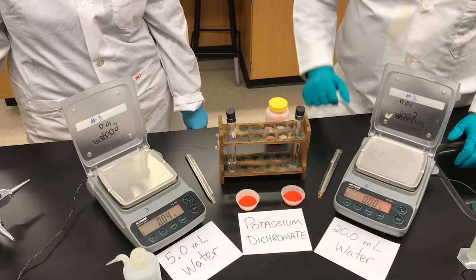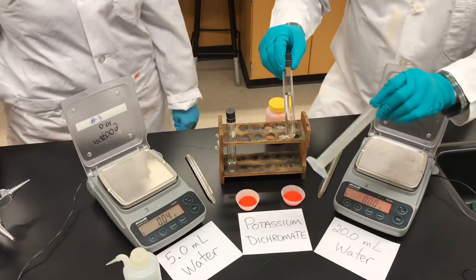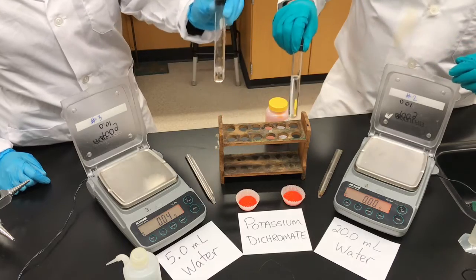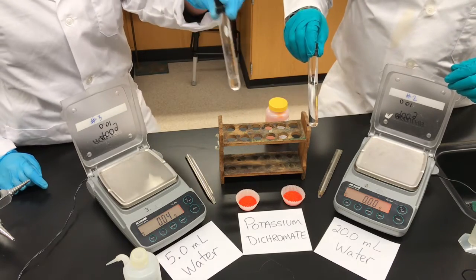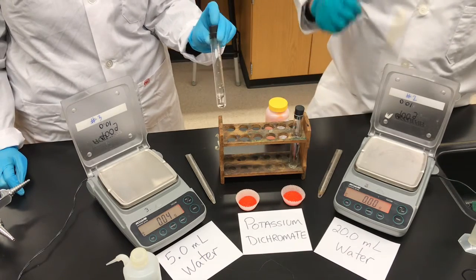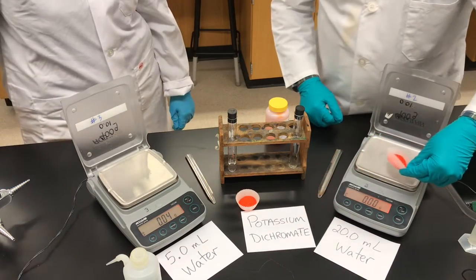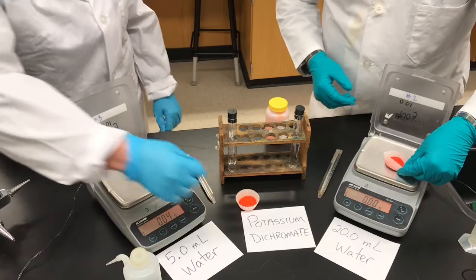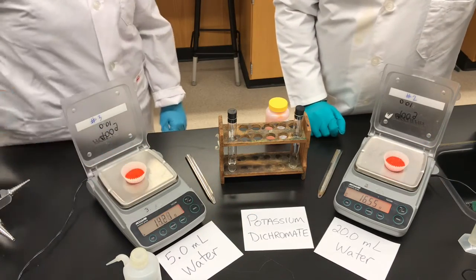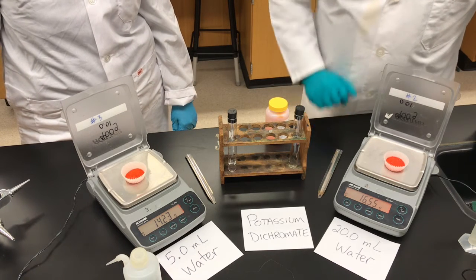We're going to get started. I've got a test tube with 20 milliliters pre-measured with a graduated cylinder of distilled water, and this is a test tube with 5 milliliters pre-measured. What we're going to do is create saturated solutions. A saturated solution is a solution that has the maximum amount of solute dissolved in it. If it has the maximum amount of salt in it, its concentration will be the highest possible for that salt at a given temperature.